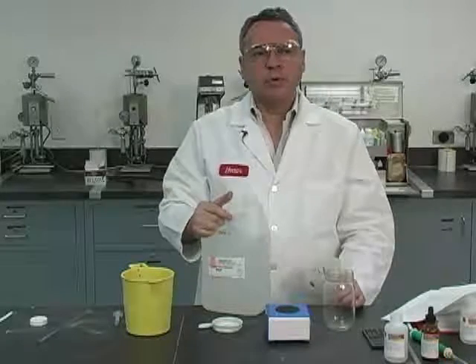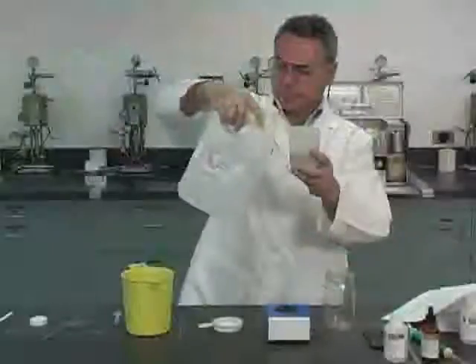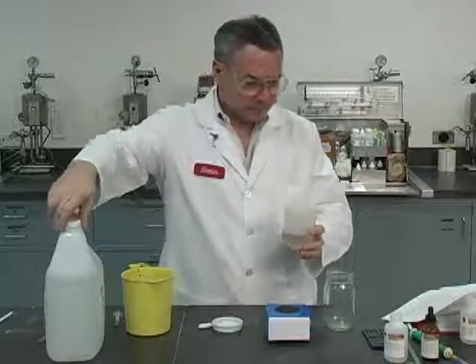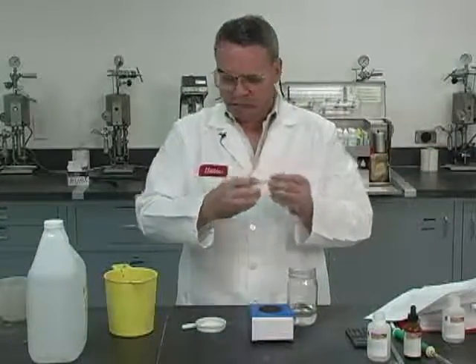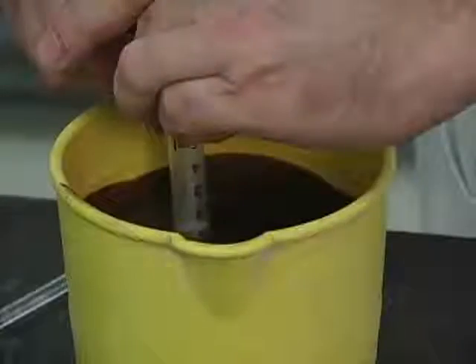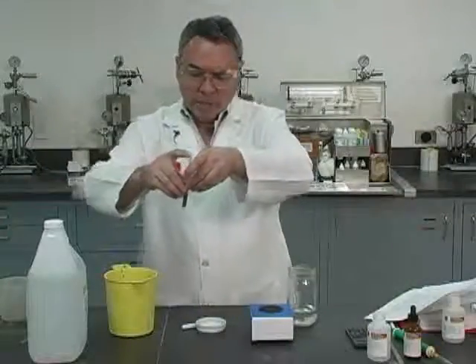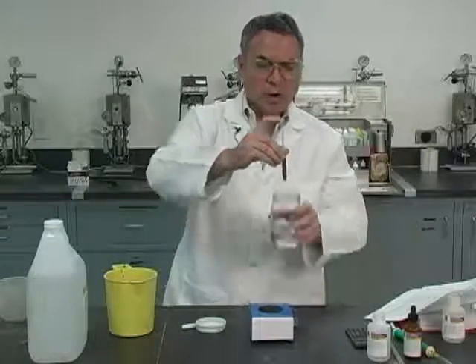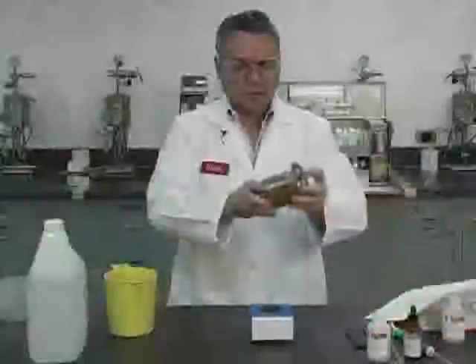The calcium content is going to be expressed as milligrams per liter of whole mud, which is the API way. We add the solvent into the jar, then the sample — using a syringe, I pull to three cc's and go down to one, so my total sample size is two cc's. I clean it so I can see the graduation, going from three to one. Close the jar and shake it for about a minute. This gives the PNP the possibility of breaking the emulsion.